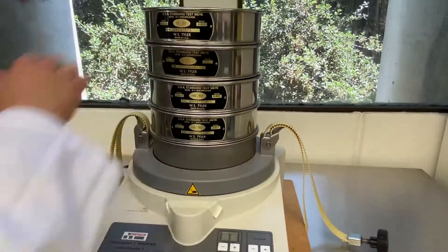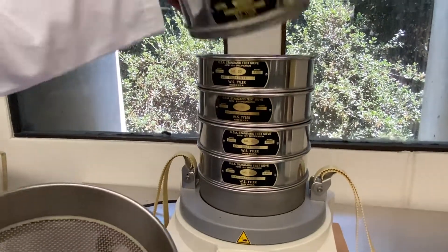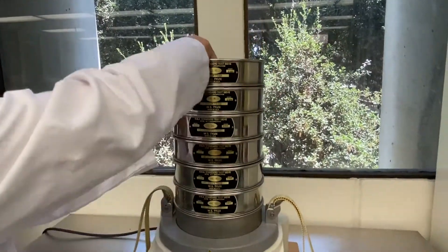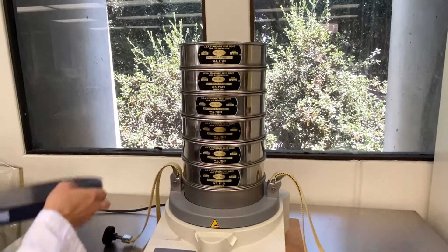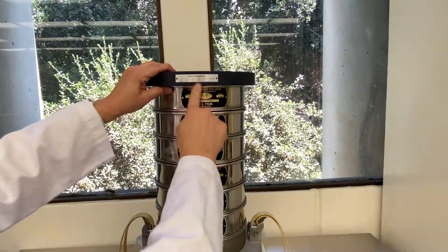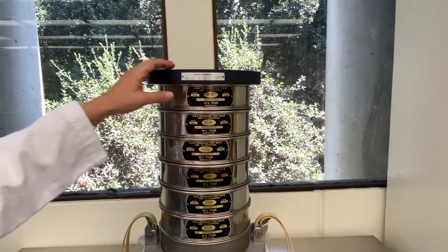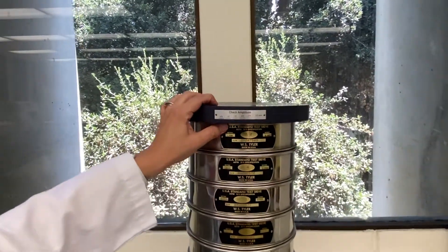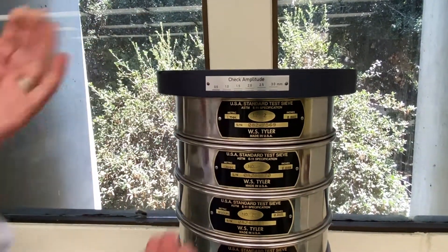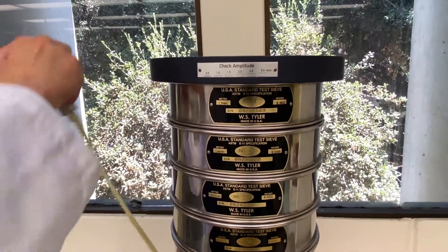What we do is we place our coffee in this top sieve here. Then we reapply the lid, and it's very important that the lid faces this way, because we will determine the necessary amount of shaking is reached when these two lines blur together. So it meets the face front so that you can see it.